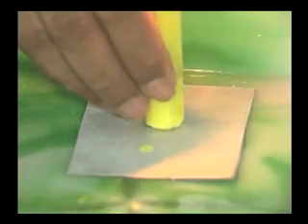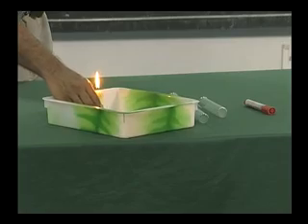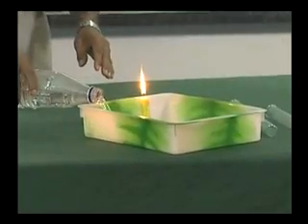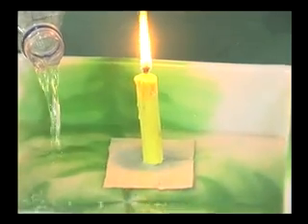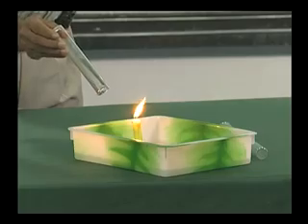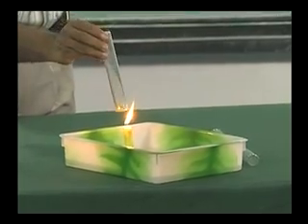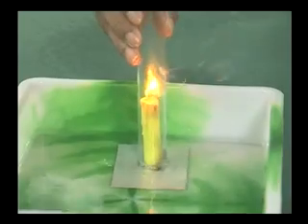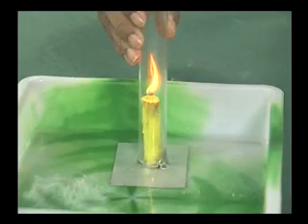You can see here a candle placed inside a tray. I quickly invert a glass tube closed at one end over the candle.